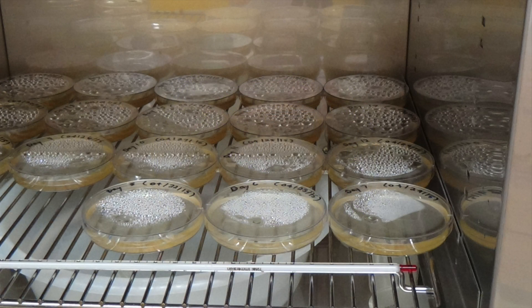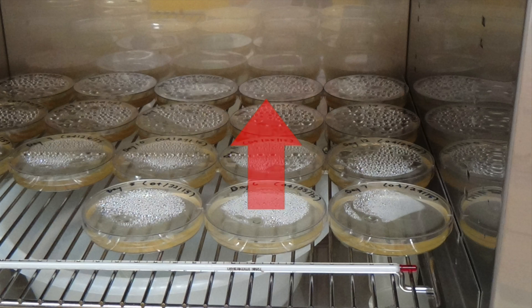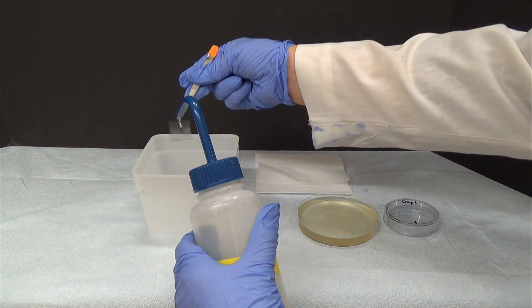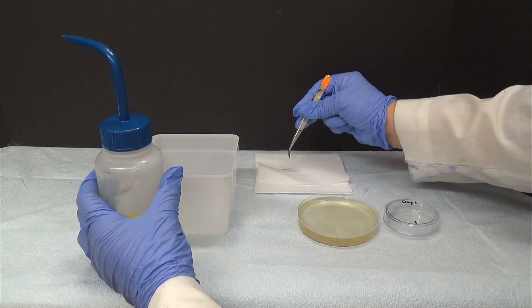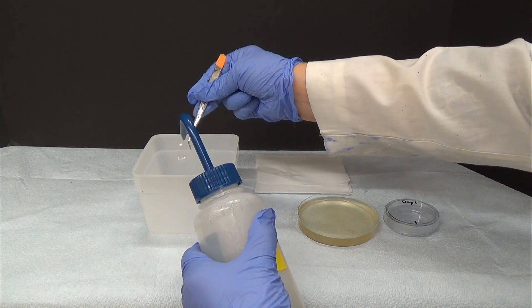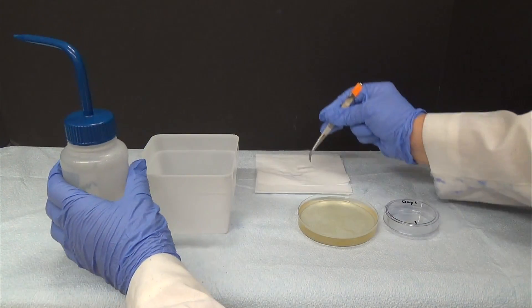Take care when picking up cover slips with forceps — they are easy to break and drop. On the first day of data collection, make sure to maintain the orientation of each cover slip. The side that was facing upward in the petri dish should always face upward. Remove each cover slip with sterile forceps and wash each side with a solution of 1x PBS, dabbing the excess liquid onto a kim wipe. Wash again after repositioning the forceps to make sure the entire surface of the cover slip is washed.